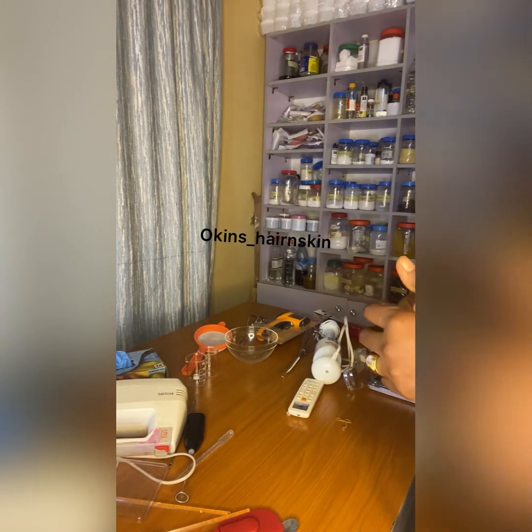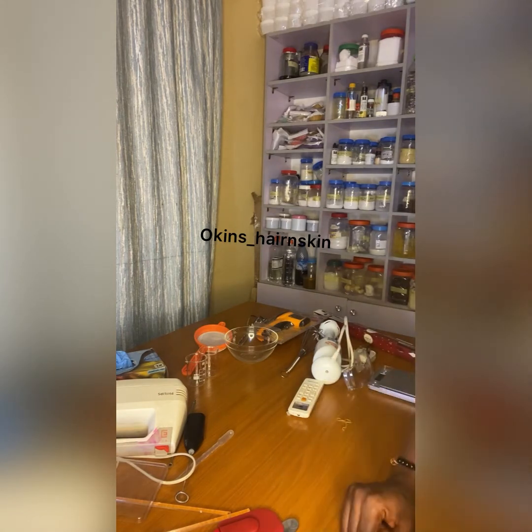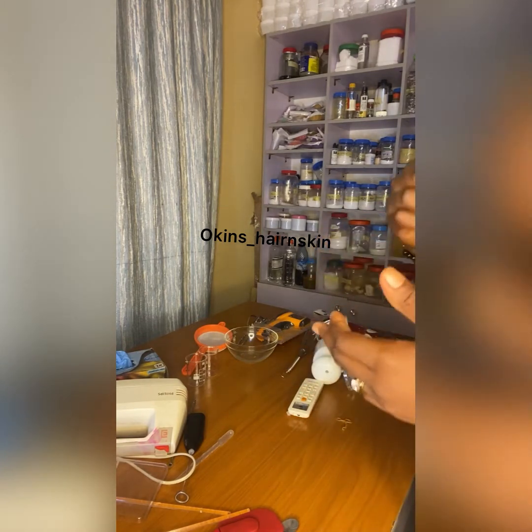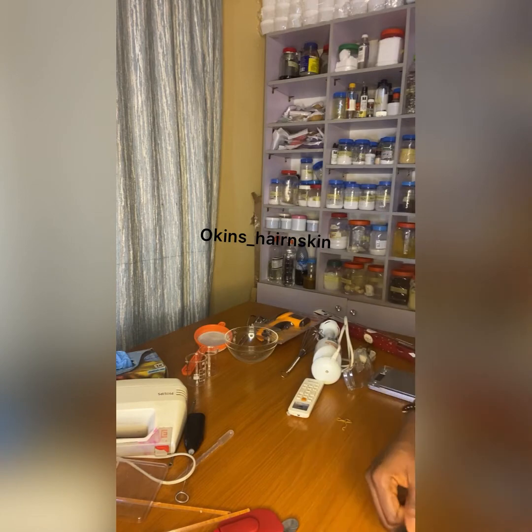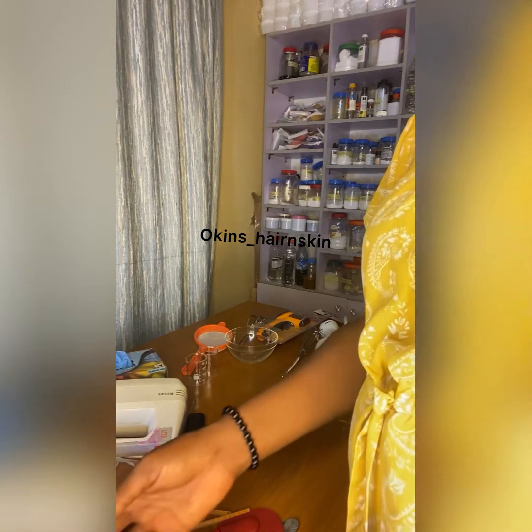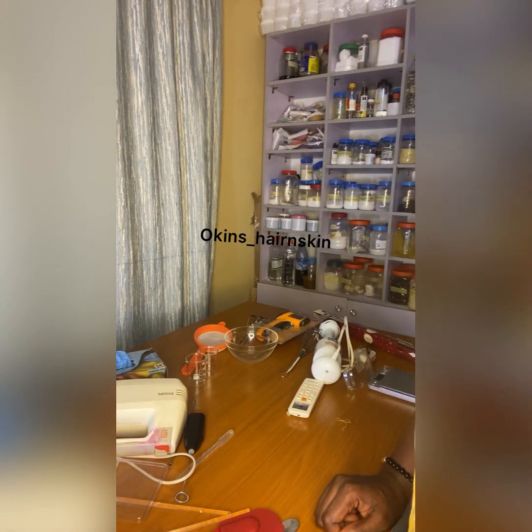You just have to make sure it's not below 3.5, and 5.5 or 6 if you are formulating a niacinamide product. So you also have to make sure it's not too alkaline, and it's also not too acidic. So the importance of the pH meter cannot be underestimated. You just have to keep that in mind.